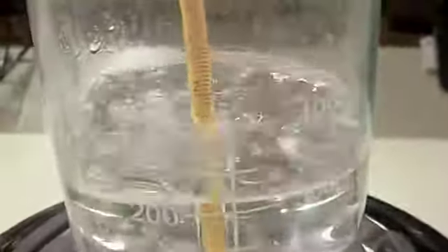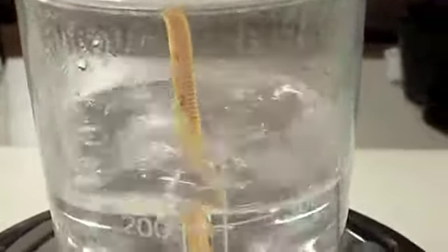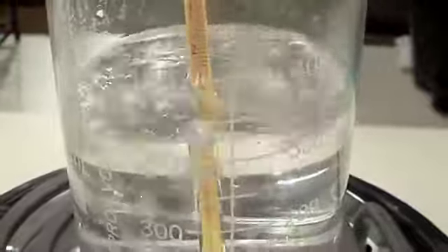It's water from the fountain, and water from the fountain has chlorine and fluoride in it, so it's safe for us to be drinking. So that might be a few reasons why it reads 97 degrees Celsius and not 100 degrees Celsius. But remember that water boils at 100 degrees Celsius and it freezes at 0 degrees Celsius. Those are the important things that you need to remember.